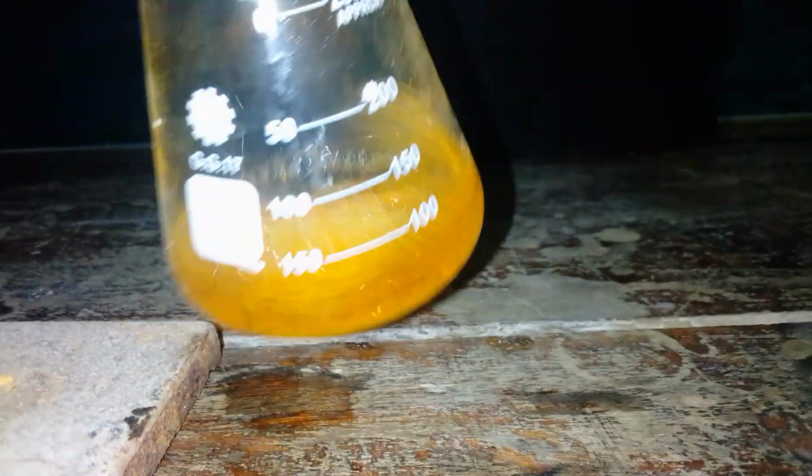You see, carbon 4 oxide is the one producing the bubbles in the conical flask because of the products that we mentioned in the first titration. The products are sodium chloride, carbon 4 oxide, and water. Slow down and make sure that you are keen when titrating, so that when the endpoint mark is reached, you just stop the titration process.